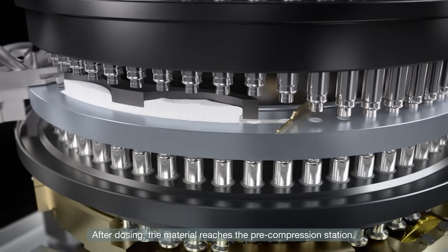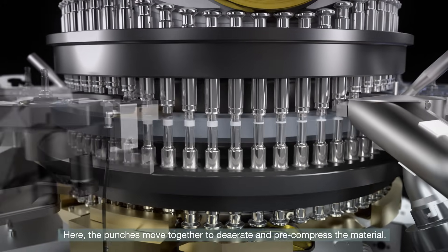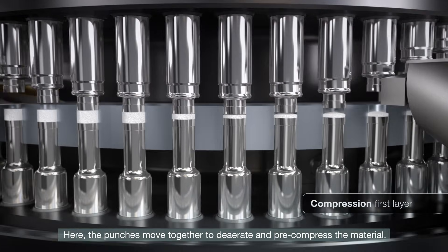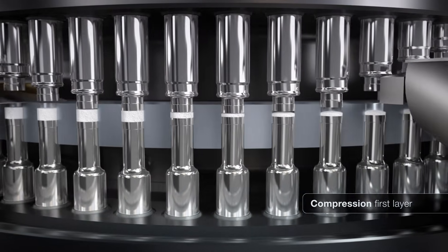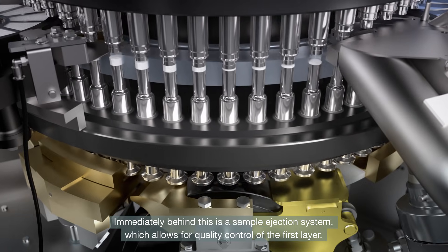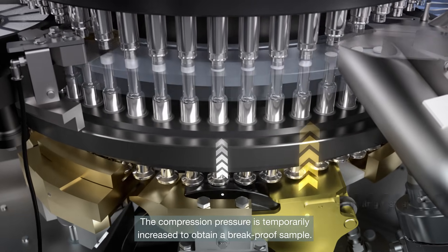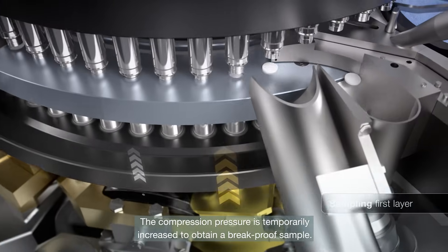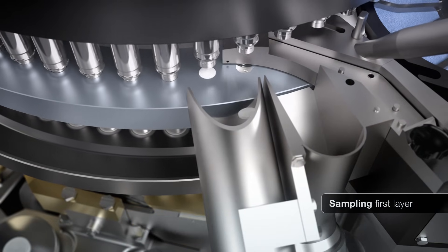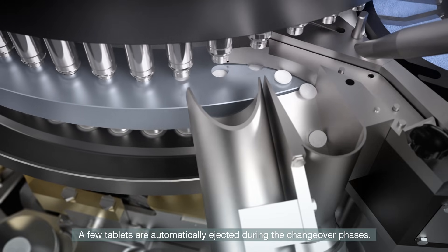After dosing, the material reaches the pre-compression station, where the punches move together to deaerate and pre-compress the material. Immediately behind this is a sample ejection system which allows for quality control of the first layer. The compression pressure is temporarily increased to obtain a break-proof sample, and a few tablets are automatically ejected during the changeover phases.